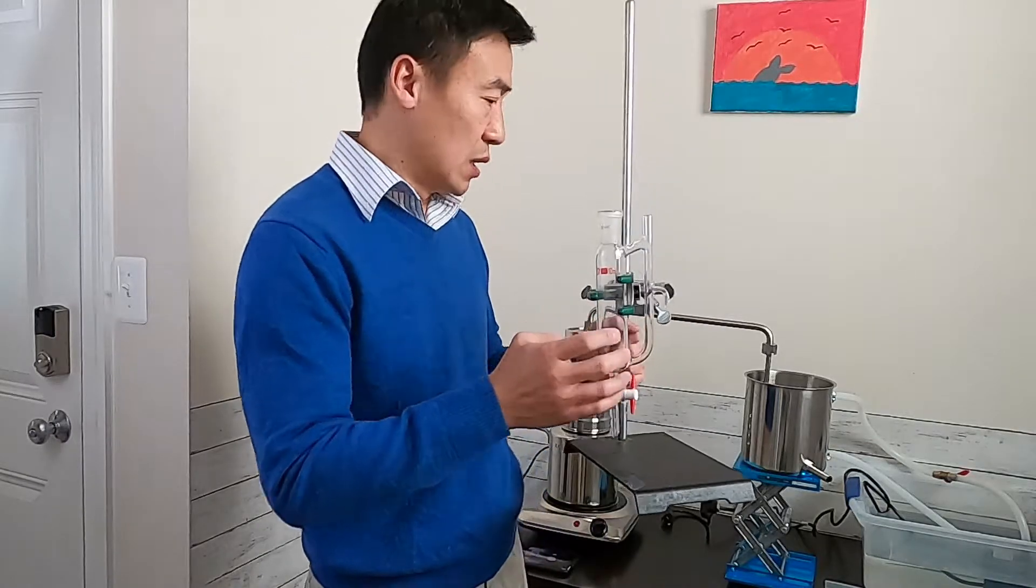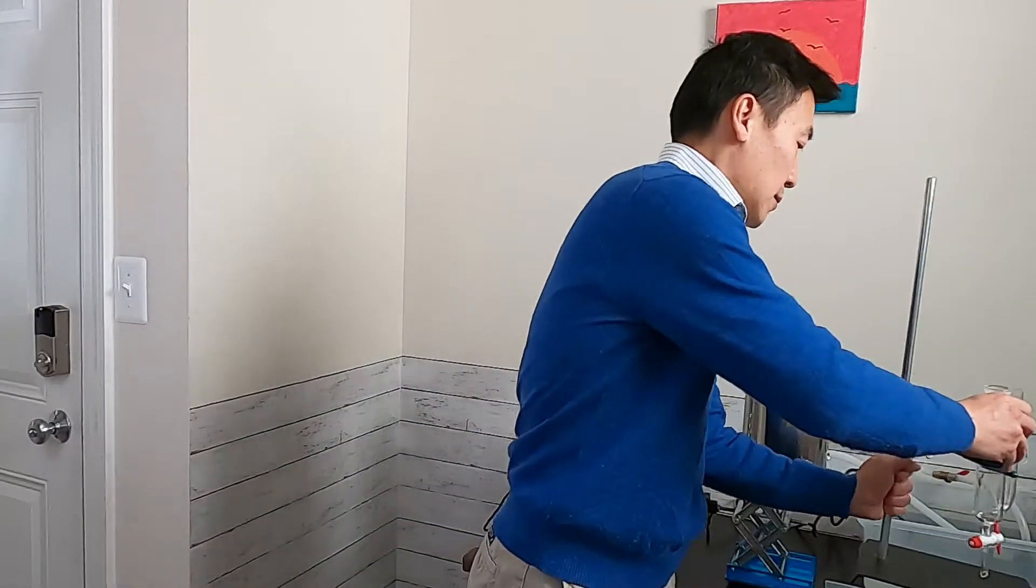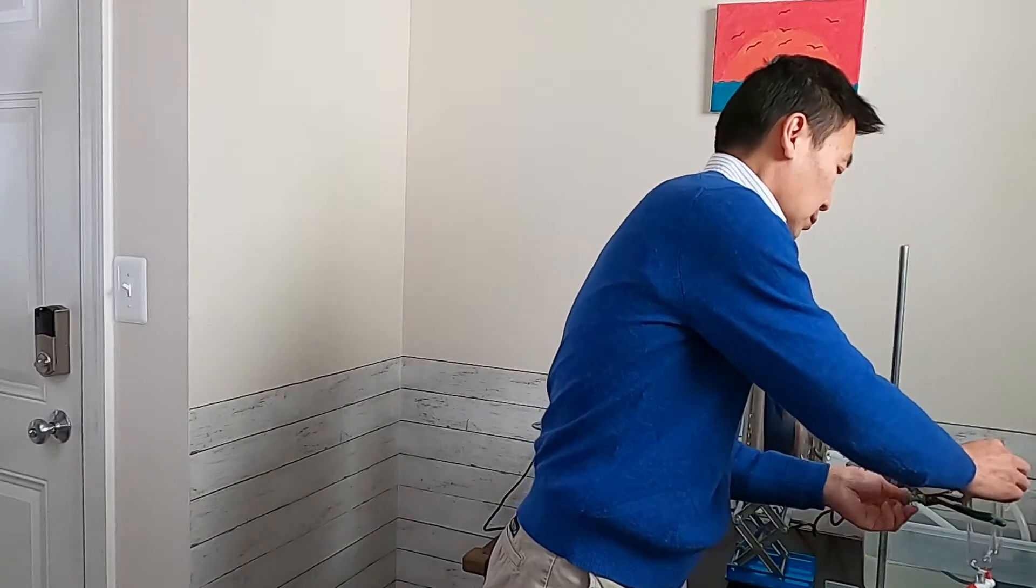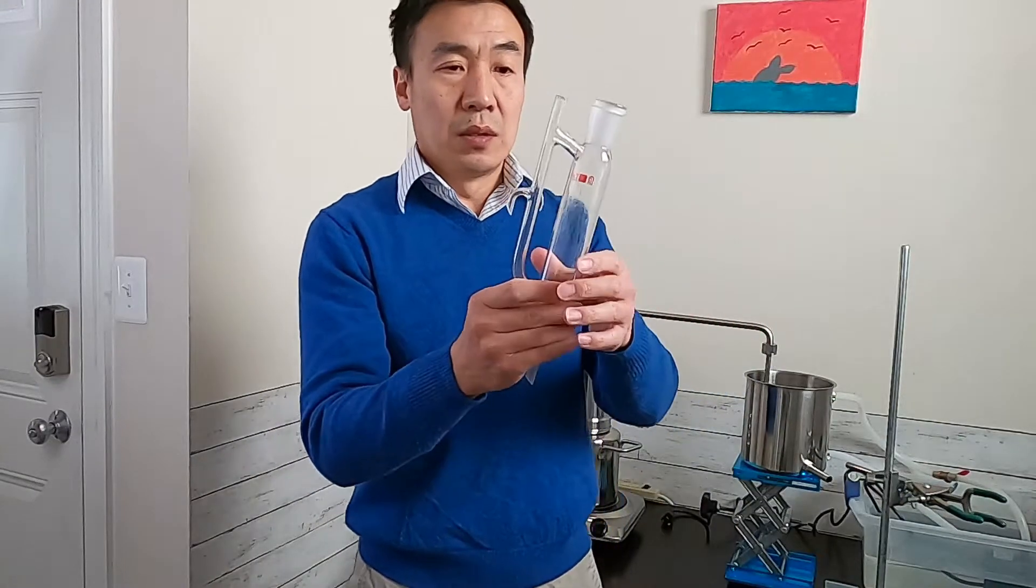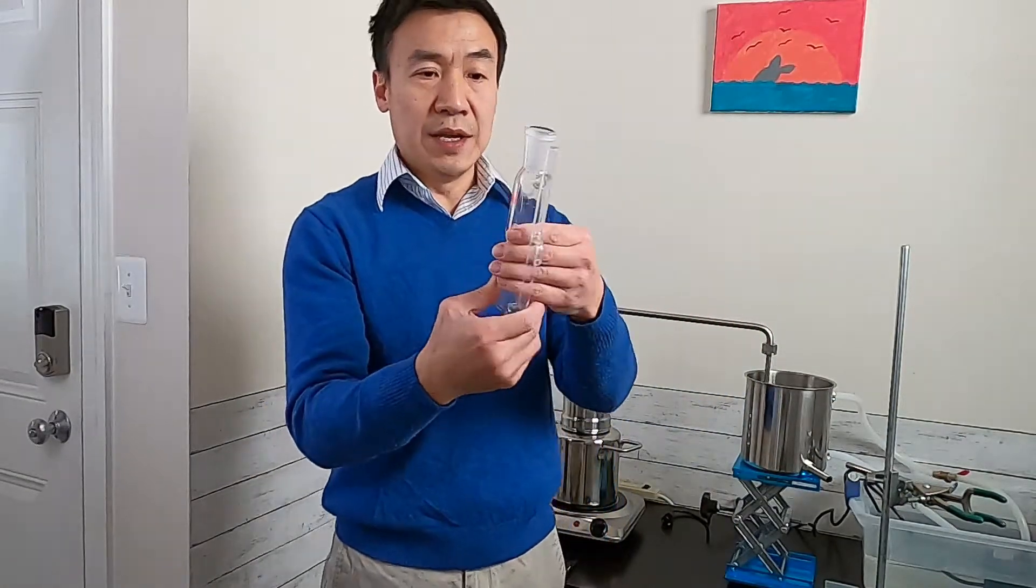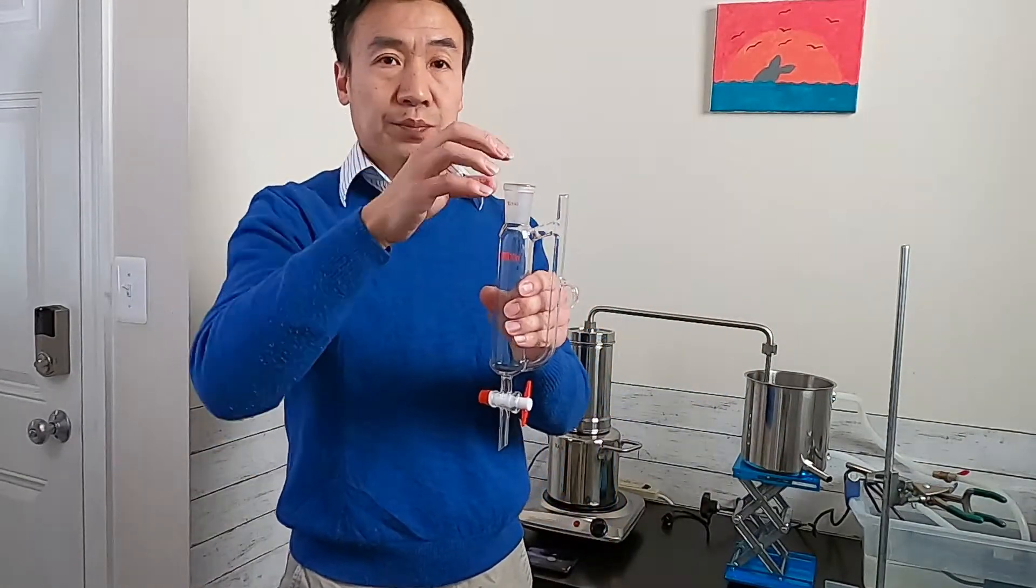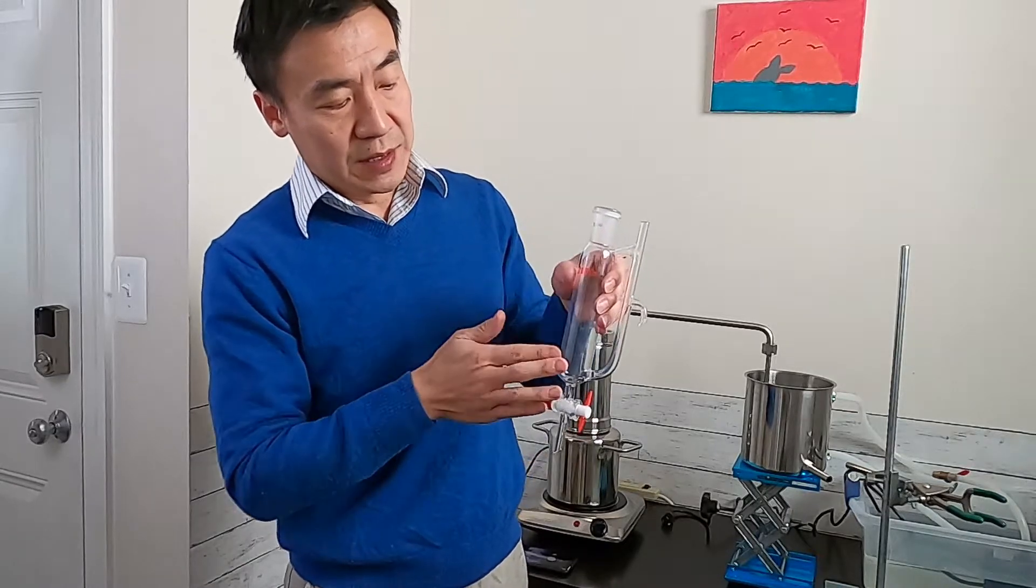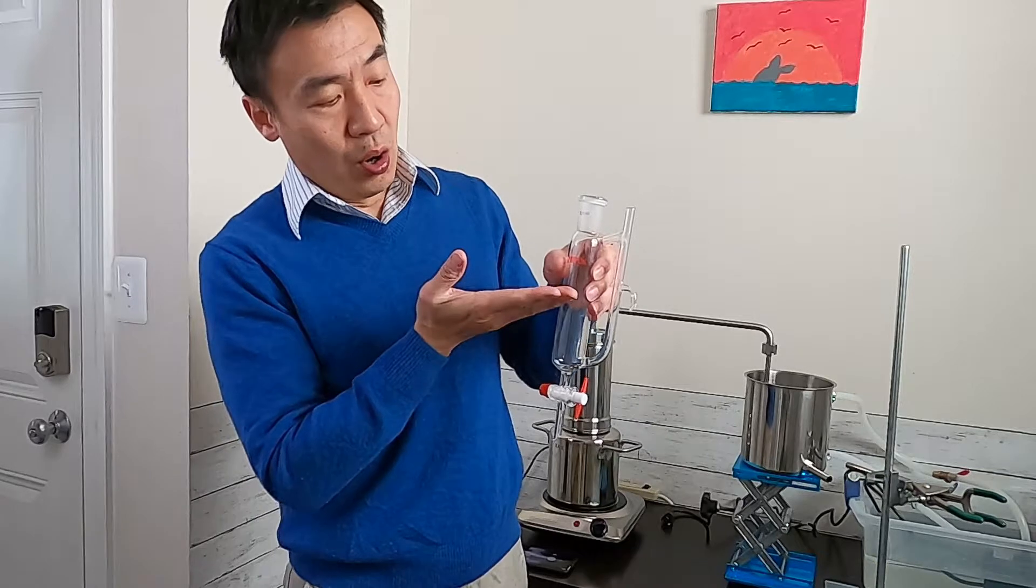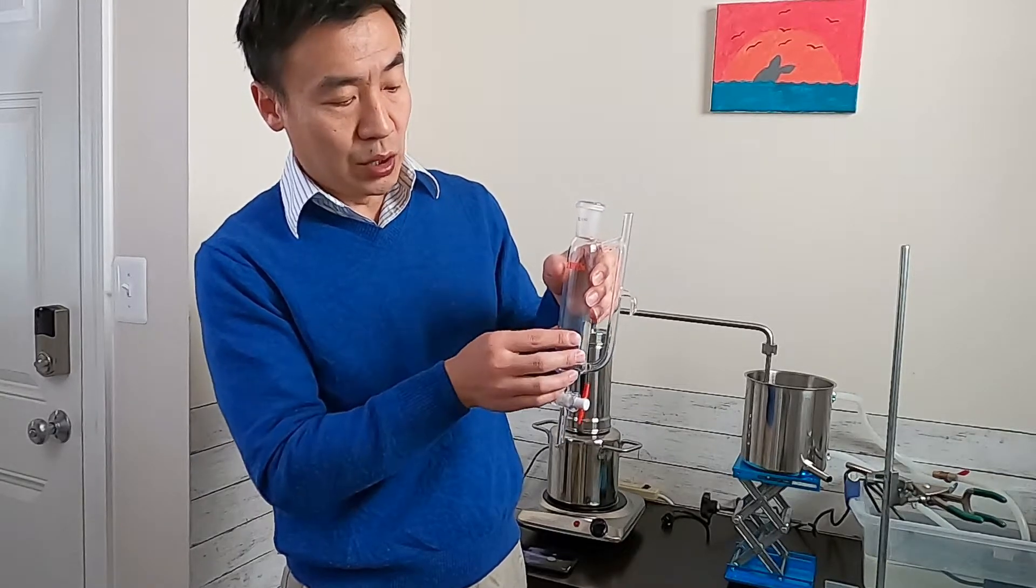How this works, let me take it out. The product, distillate, goes into here. So when these settle down here, the oil will flow on the top of the hydrosol.